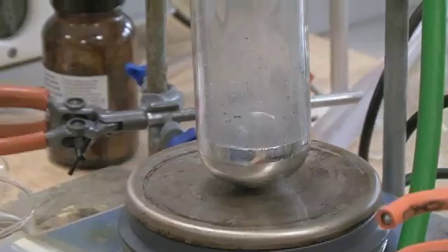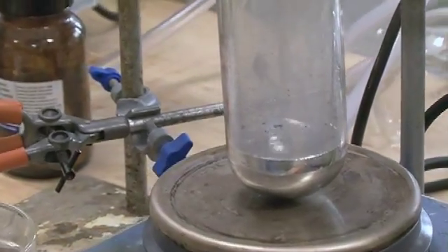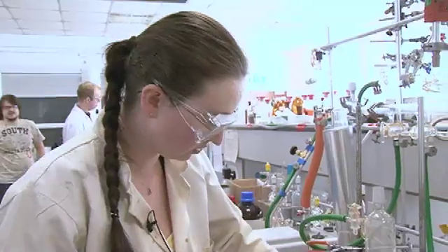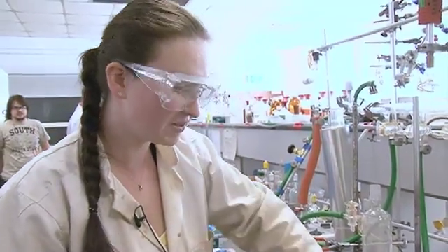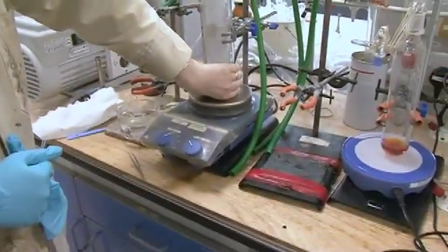And there it goes. So now it's all those three blocks of sodium that I put in, they're all dissolved in the mercury now. So they've made the amalgam. So it's getting warm. It's warmish.